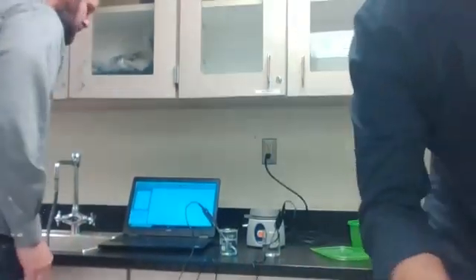Okay, station number 6 is called high specific heat. I have Professor Lambden here helping. This one is dealing with heating and cooling liquids. I'm not allowed to use the hot plates by myself because of the incident, which I'm sure you guys are aware of. Okay, anyways, water has a high specific heat.